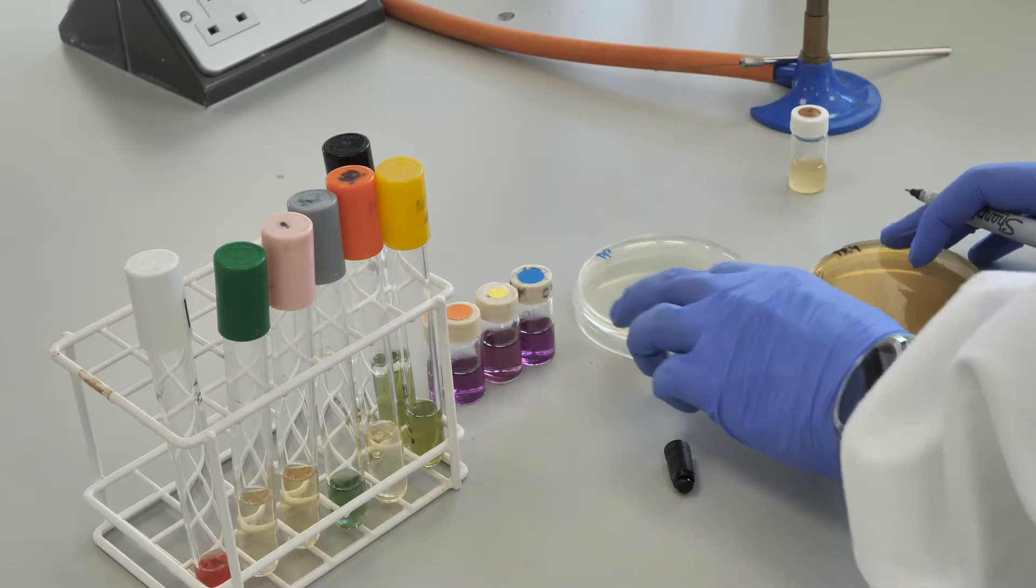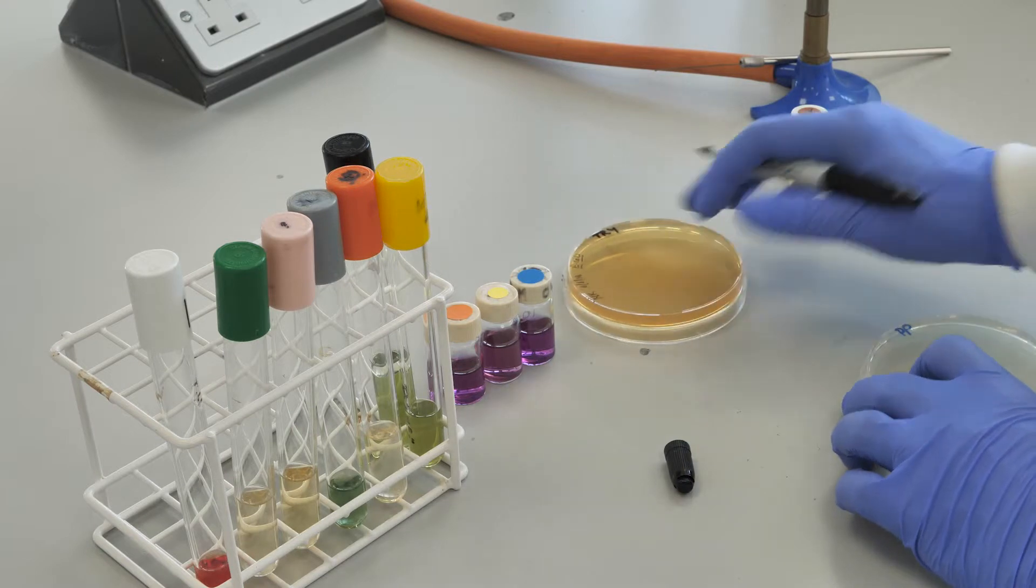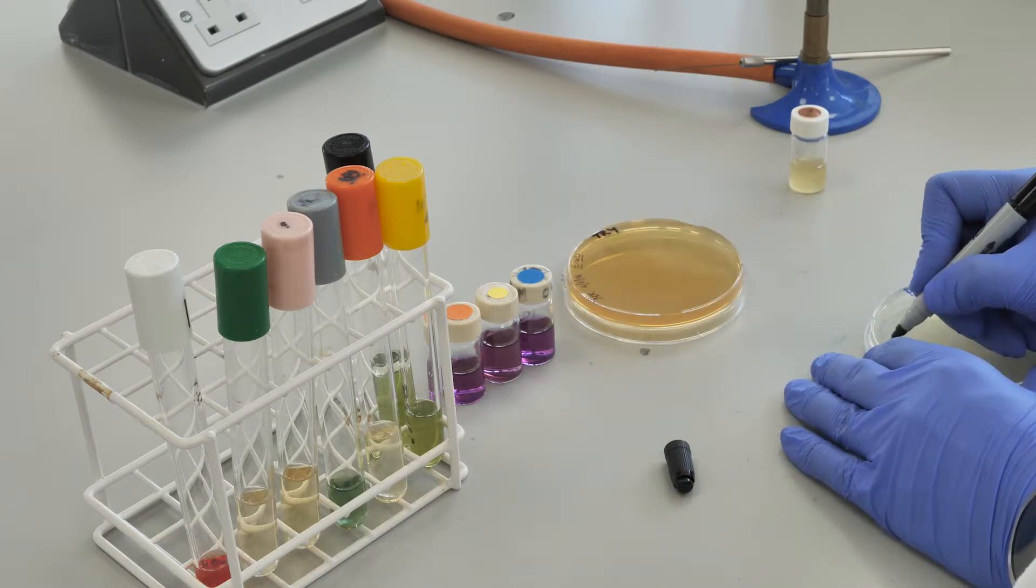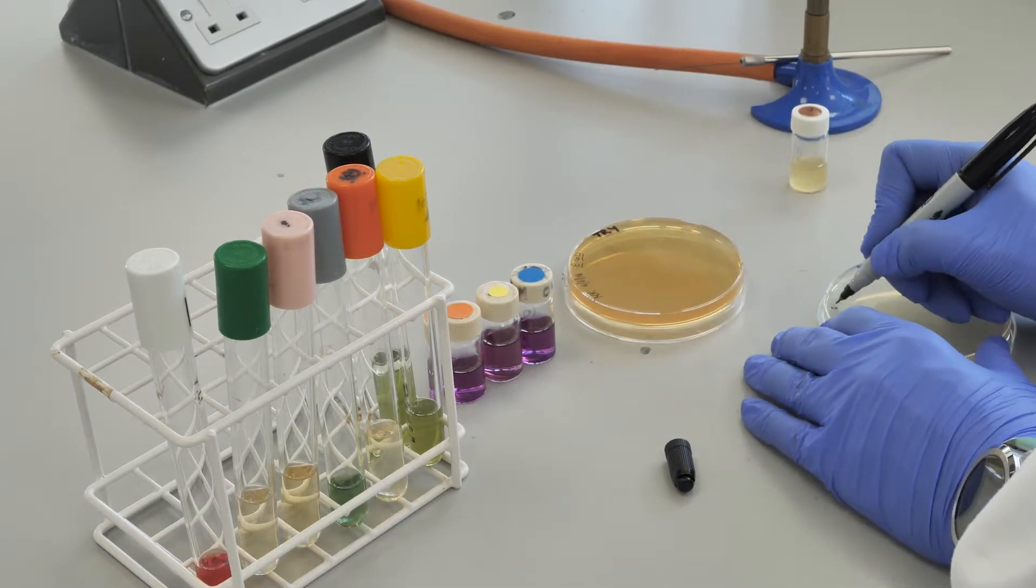Label all plates, tubes, and bijoux with your initials and the name of the bacteria you are using before beginning.